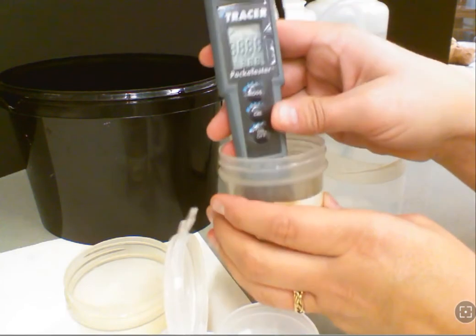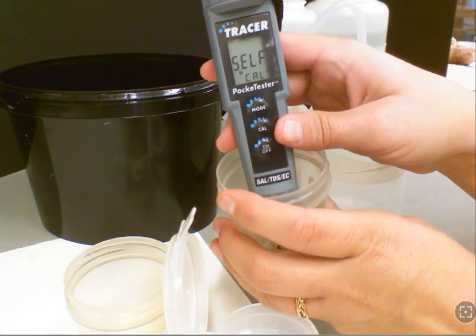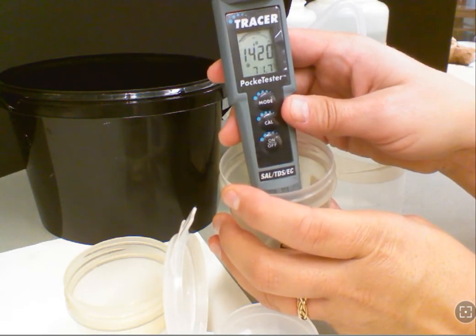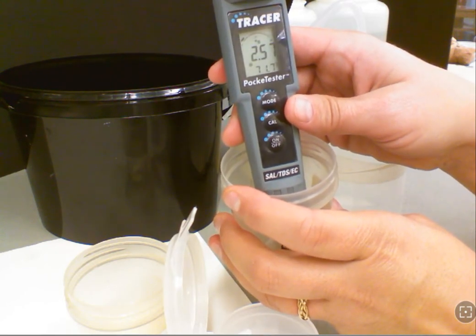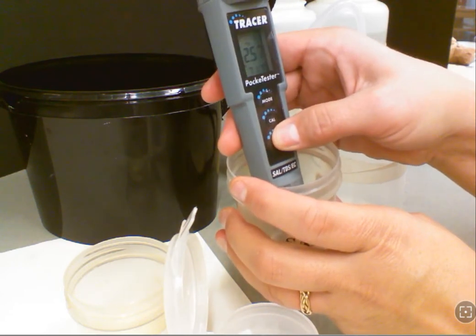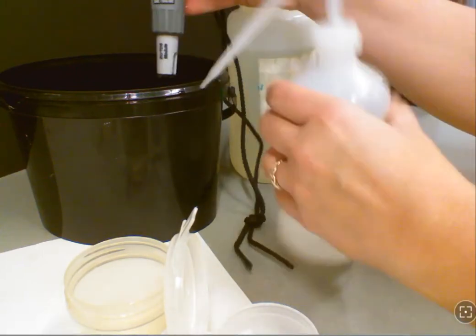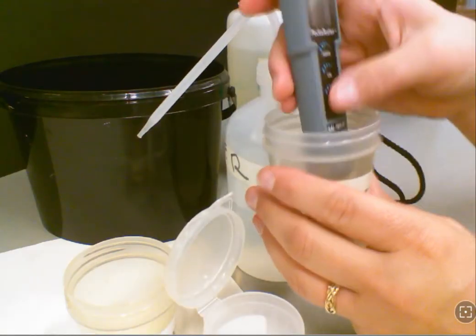Now we have Sample A and we're going to turn it on. It's going to be in conductivity mode, so we'll go ahead and record conductivity. Once you get that result, give it to your data collector. Then you can switch over to TDS — you'll need to rinse your probe off and repeat that test. Your meter will measure TDS and you can record that data too.